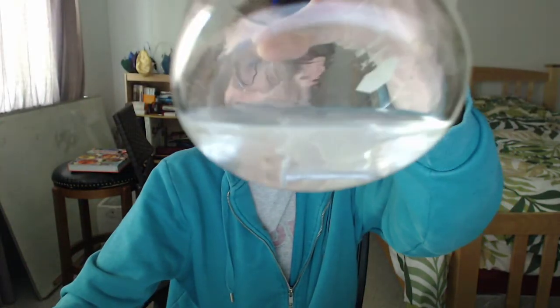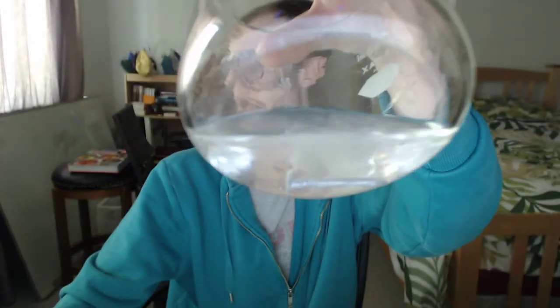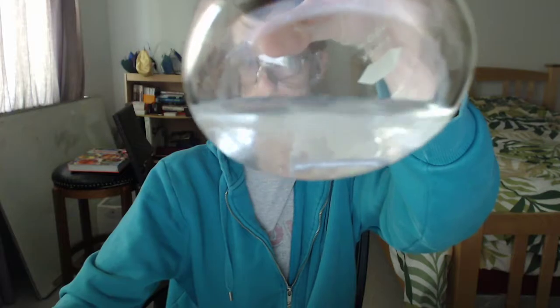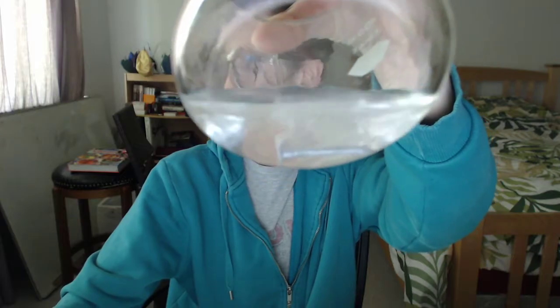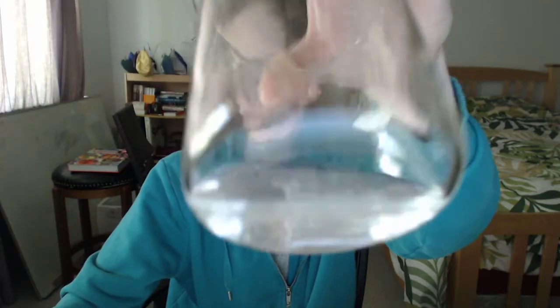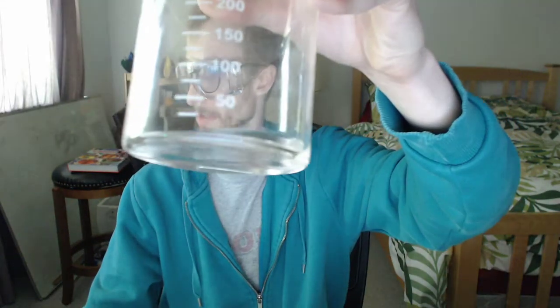You can see that it's bubbling pretty fierce there, coming off the edge. And the other one, there's nothing happening. Just sitting there.